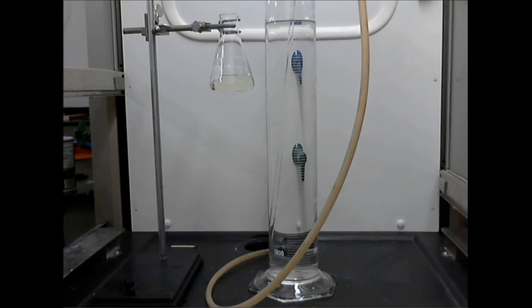Now, once I get this going, I'm going to develop some very dangerous fumes. Chlorine gas is extremely toxic. Please do not try this at home. You're going to see that I have to act very quickly to make sure that as much chlorine gas as possible makes it through the water and bubbles up instead of being trapped in the fume hood. But regardless, this is all taking place in a ventilated fume hood, so I don't have to worry about fumes building up in the room that I'm standing in.